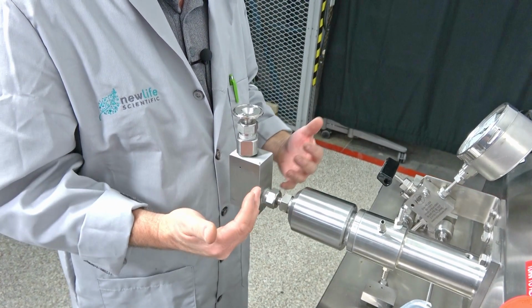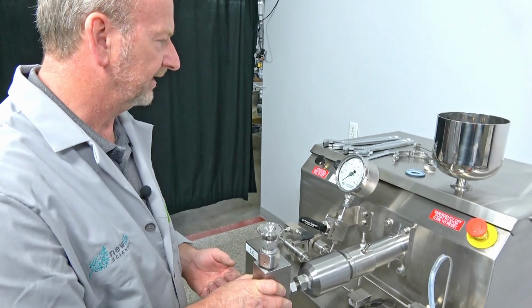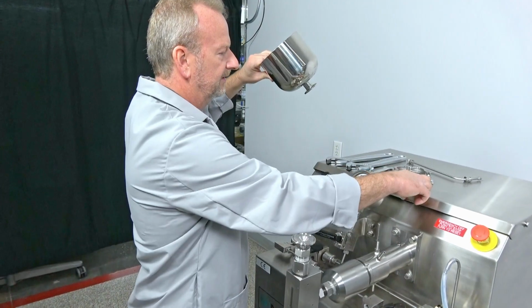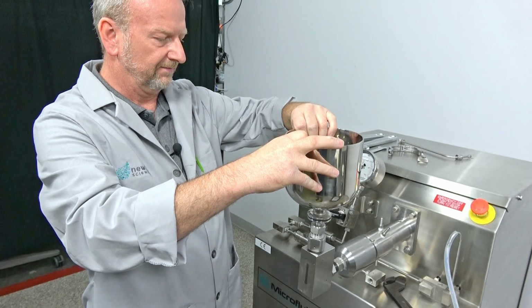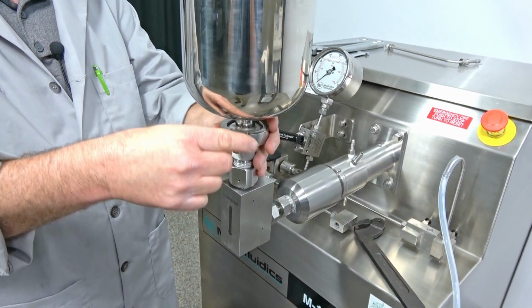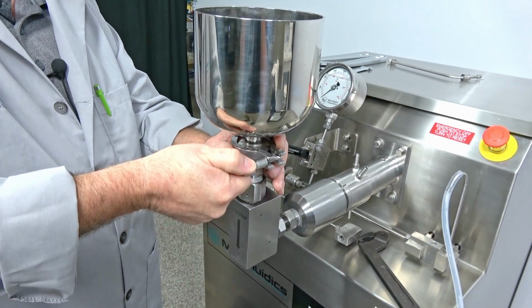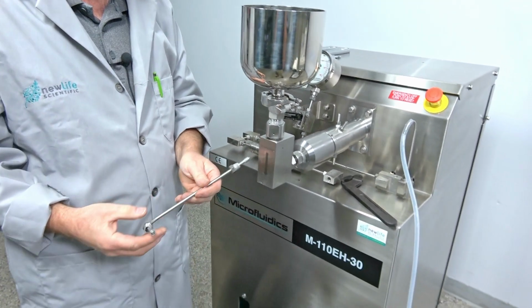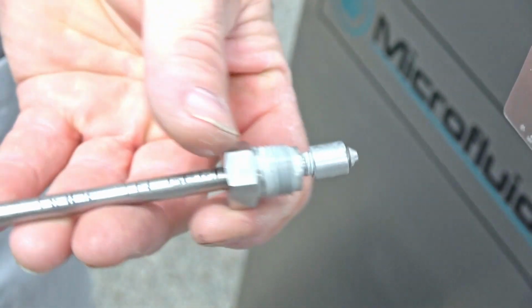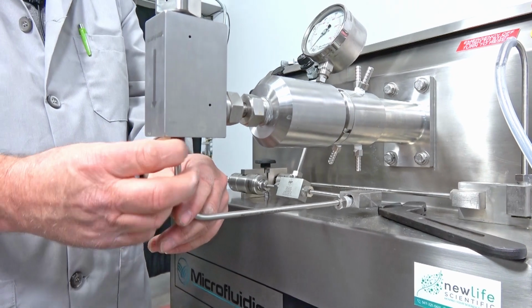You have now seen how to replace that teeny little plunger seal that creates the high pressure and seals. Once you go through it like that, you put the seal back on here, put the reservoir back on there, and just replace your clamp here. And then you've got your feed line here. Again, check the position of your collars. Make sure you see about 2 threads showing on the end of the cone, like that. Then you're just going to stick this in and up here. Just hand tighten it there.